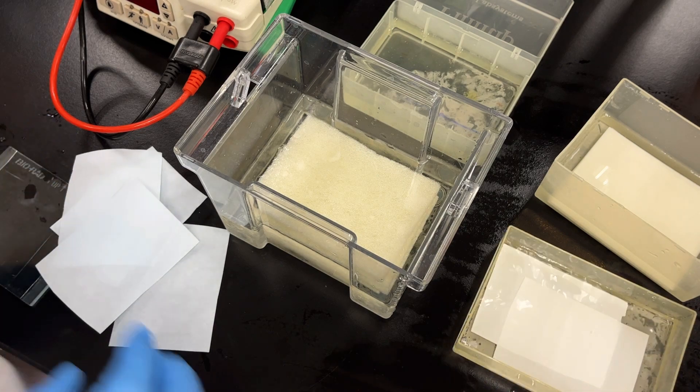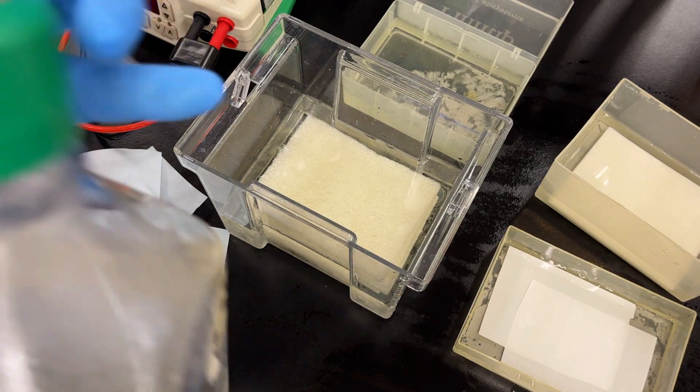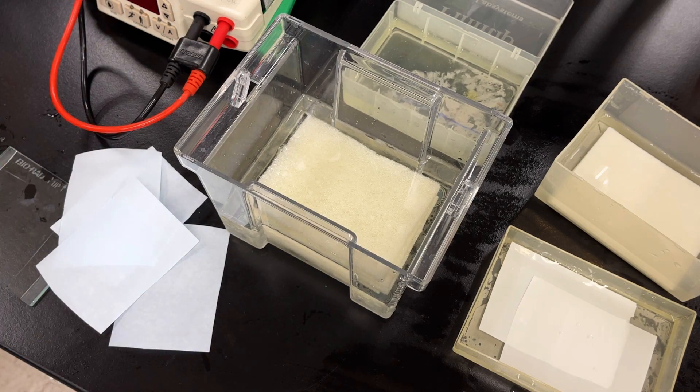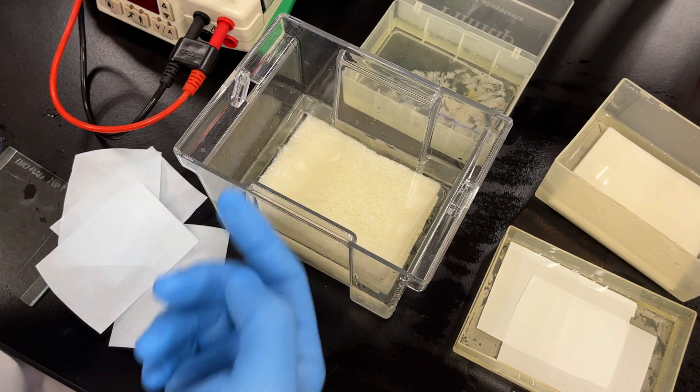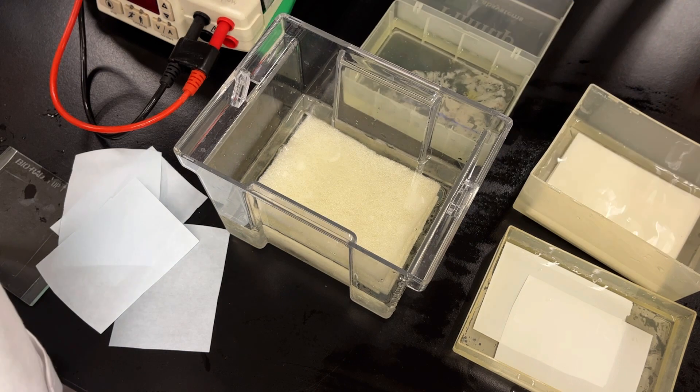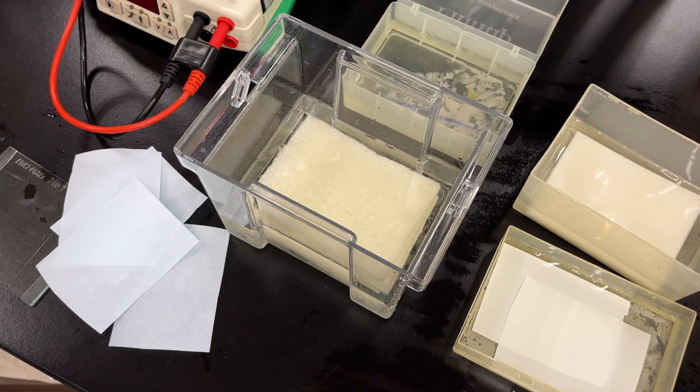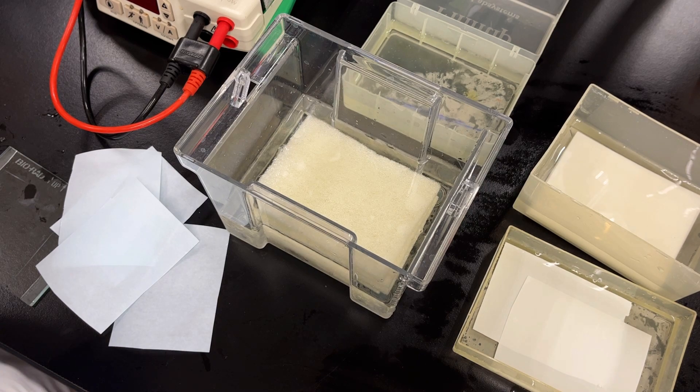Let it soak in transfer buffer. Keep your transfer buffer nice and cold, so don't bring it out until right before you set everything up. And then we have everything soaking. So we need two sponges per gel, we need two filters per gel. We got our gels that we rinsed in distilled water now sitting in transfer buffer and of course our two membranes. Everything 10 minutes.